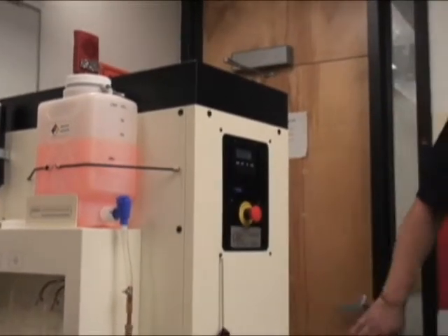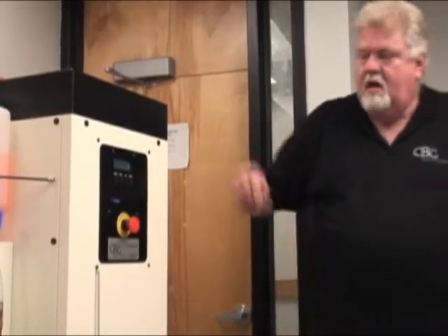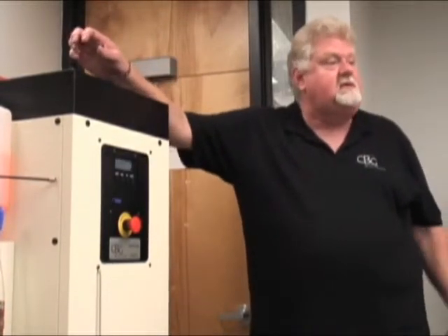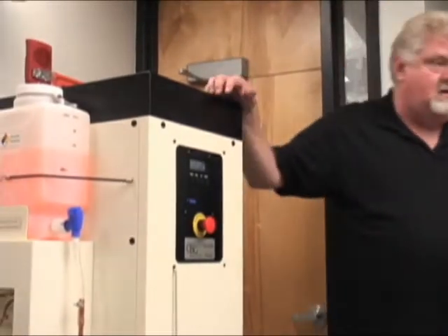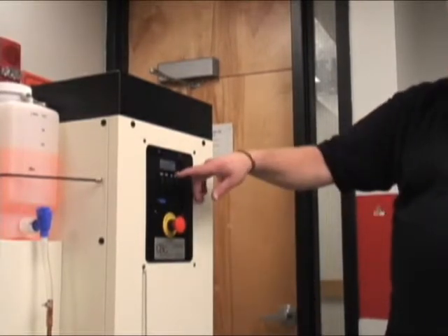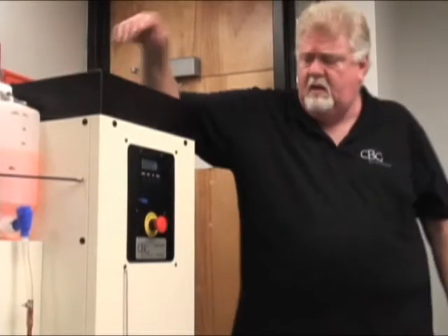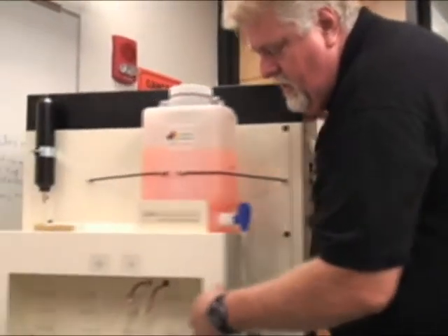That liter has gone in to clear out the line in the tank. It runs for about twelve minutes or so by itself, which really doesn't matter to you. Then it opens the waste drain, dumps that liter to waste. So that liter will be wasted on the first run of alcohol. Then it closes — and this is the cool part — it restarts itself. And now it will recycle the rest of this alcohol, minus that one liter, without you even being here. So the clean, clear alcohol will come out here into this container.